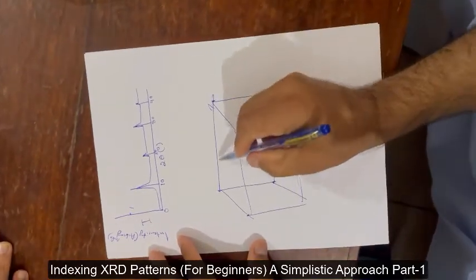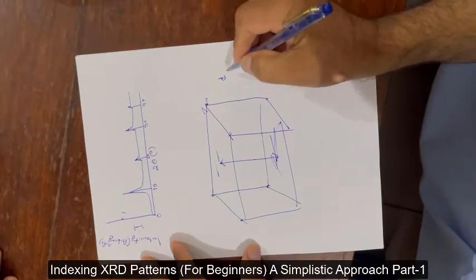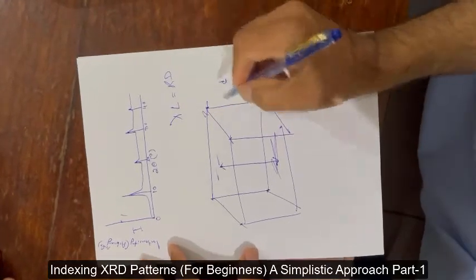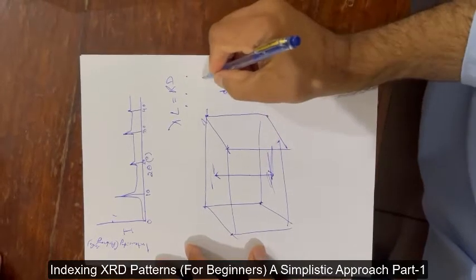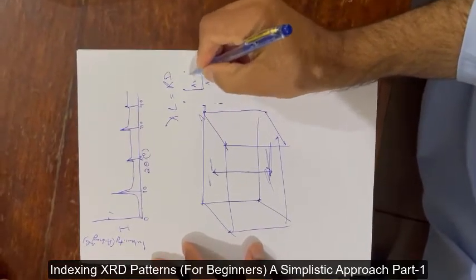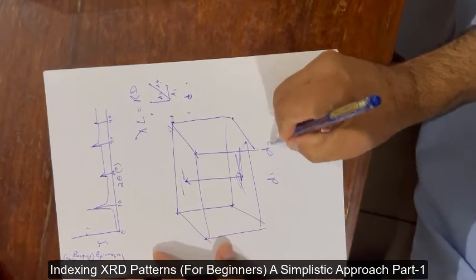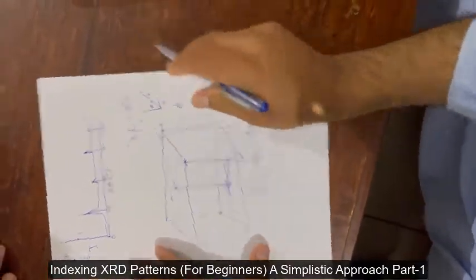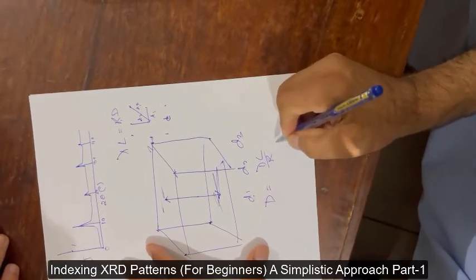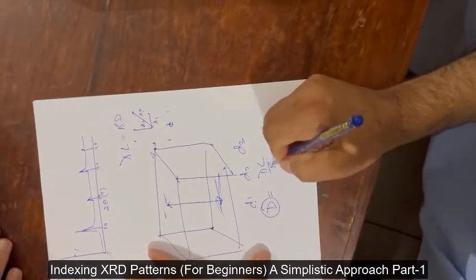This is one plane and this is another plane, and the distance between these two planes — if you go to electron microscopy, it is very simple: lambda·L = r·d. In the diffraction pattern, these values are r1, r2, r3, and r1, r2, r3 correspond to d1, d2, d3. d is equal to lambda·L over r.